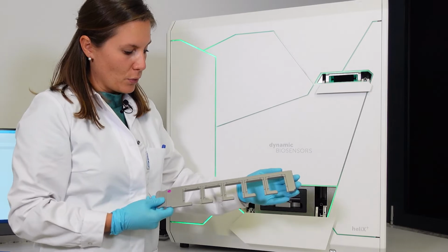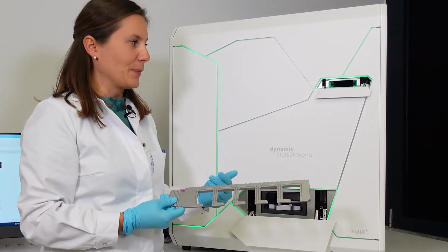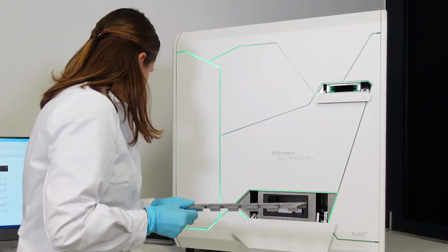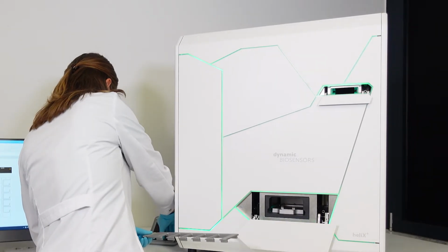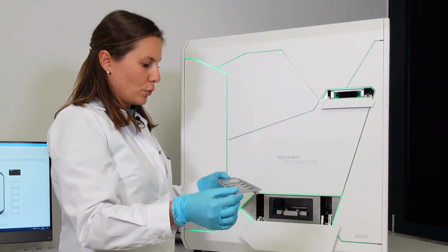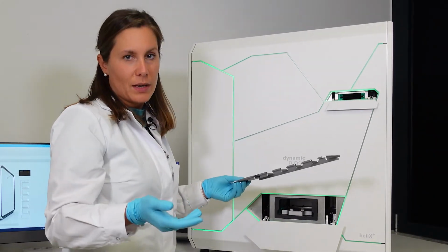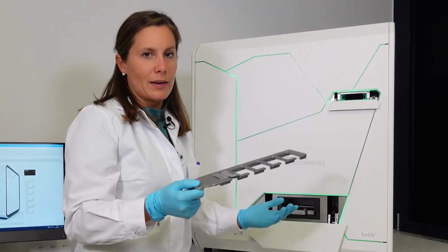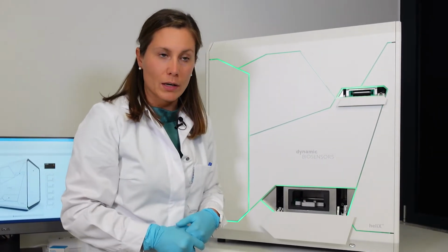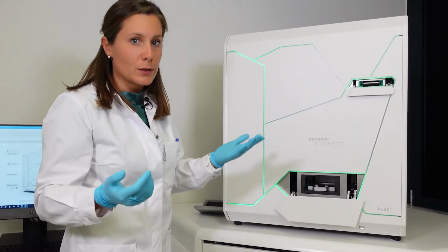This is our chip tray. We can locate up to 5 chips, but today, as we said before, we just use position 1 with 1 single chip. Let me just take it very quickly. Here we are. It's very easy and straightforward to place it because we have some magnets that help the position. So if you turn it, nothing happens. So you cannot do anything wrong, basically. Let's put it back, and now let's inject the trays back, and we can start our long experiment.